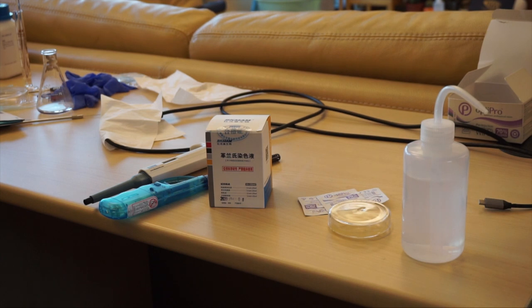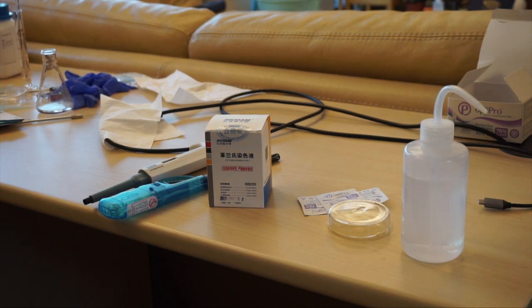Hello! Today I'm going to be showing you how to observe bacteria under the microscope with oil immersion.